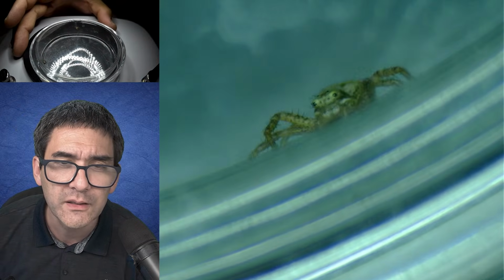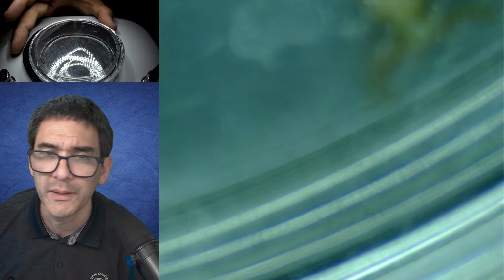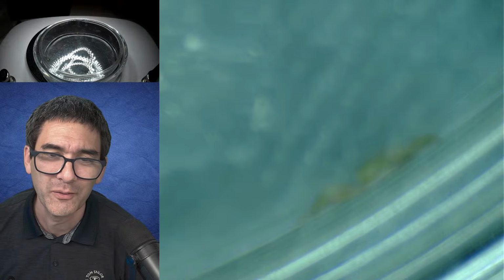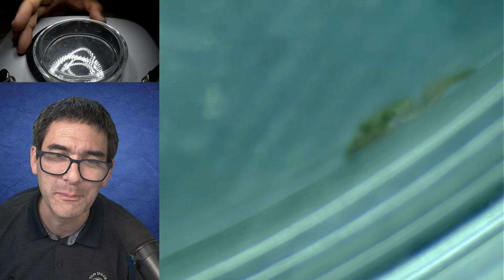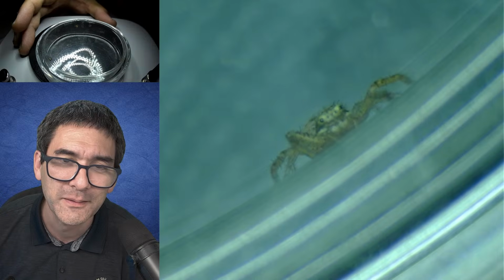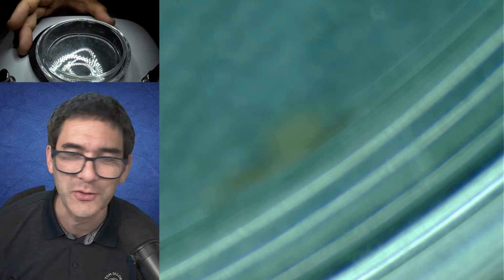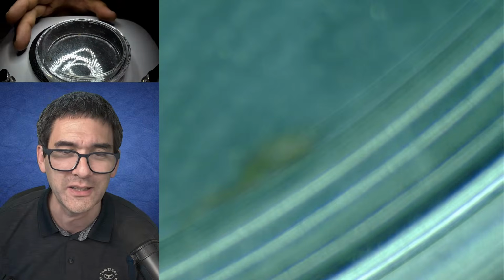But somehow instinctively they, here we all see the eyes. Up, and it fell off. Yeah, the sides of the petri dish are quite slippery. To a certain extent, I almost dare not say it, they do look kind of cute.